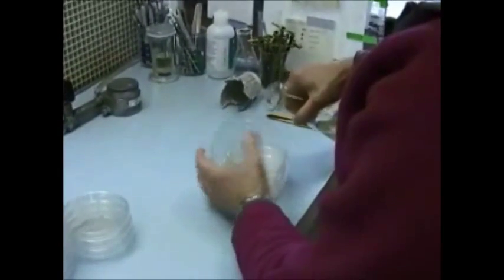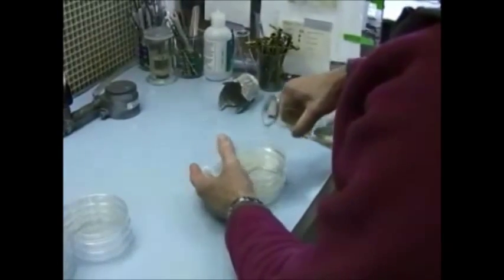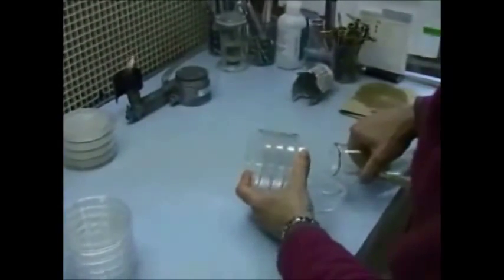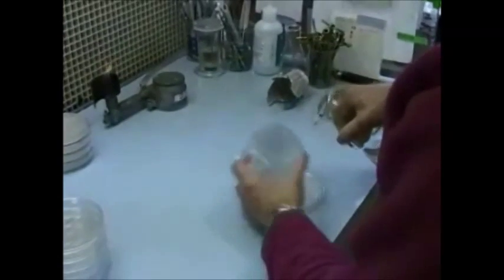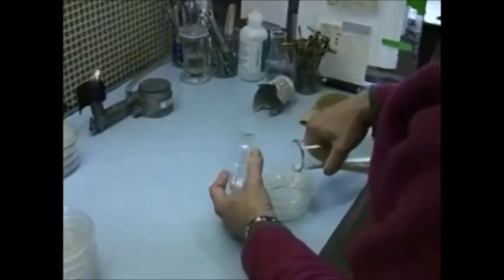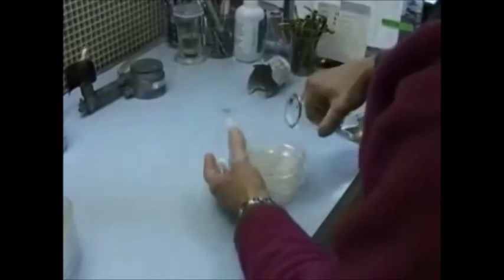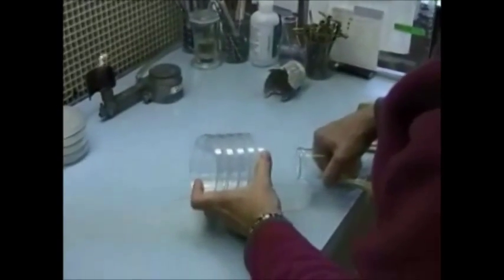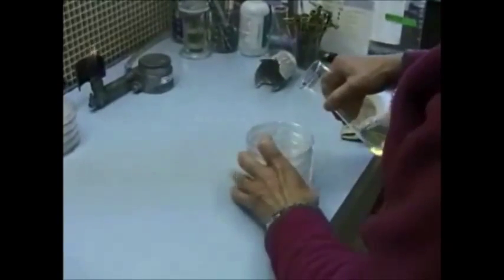She's pouring a stack of about five plates at a time, lifting the lid of the next plate above. She's pouring the agar about halfway across the plate, then swirling the plates to uniformly disperse the agar and setting them aside to cool. She repeats this process until the whole half liter of agar is poured. It's important to have the agar cooled off — you don't want air bubbles in the agar, and that's what happens if you try to pour the plates when they're too hot. Air bubbles really mess up your ability to look at the fungi on the plates once you've got your cultures going.